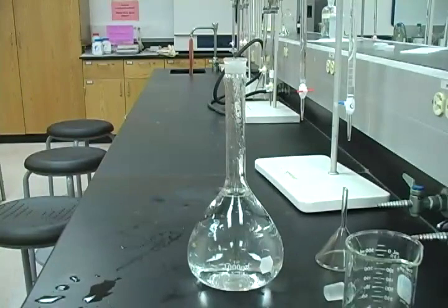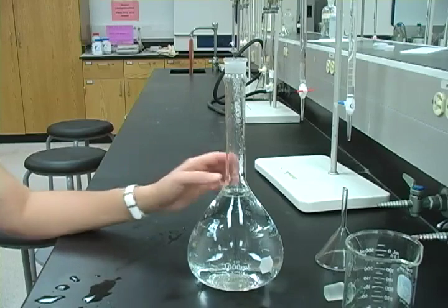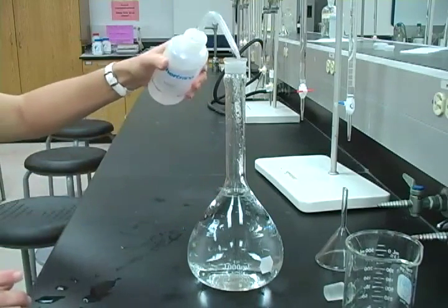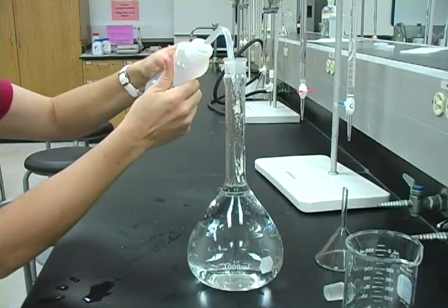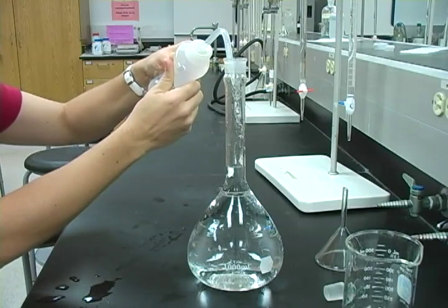After rinsing enough times, you then want to very accurately dilute the solution to the 1,000 ml mark that's on the neck of your flask. You can add water fairly quickly until you reach the neck of the flask, and now you want to slow down your delivery of water. You can also use a Pasteur pipette here, but the key is to not exceed the line that's on the neck of the flask, and you should be watching this at eye level, just like you would read a burette.